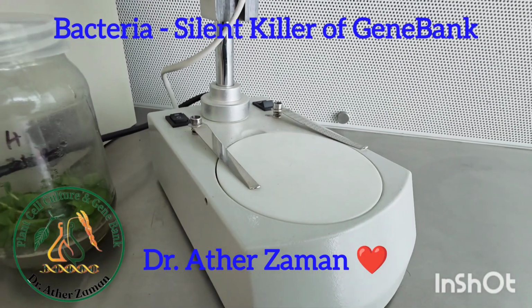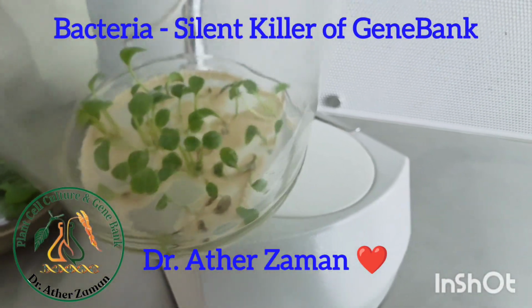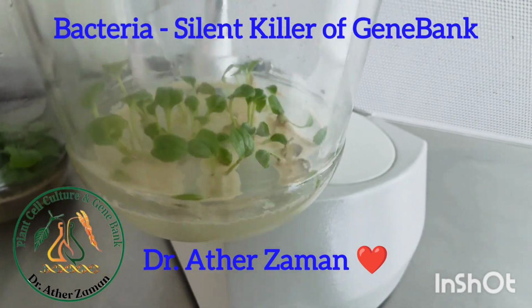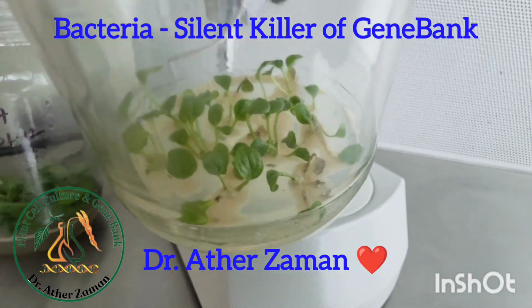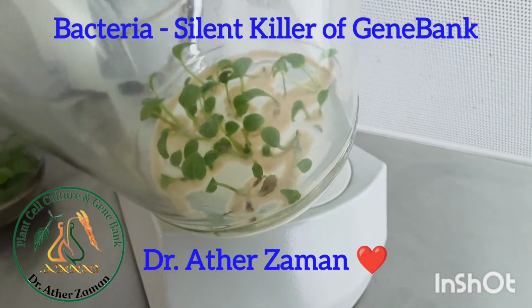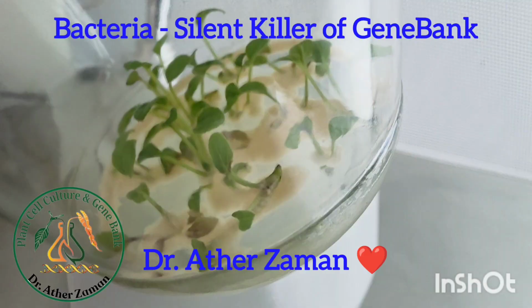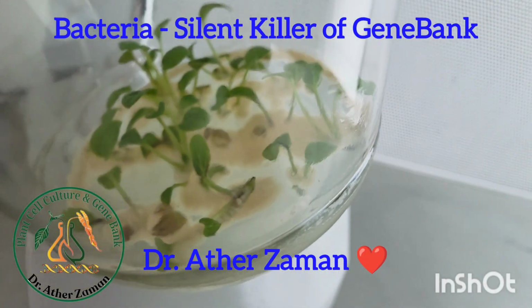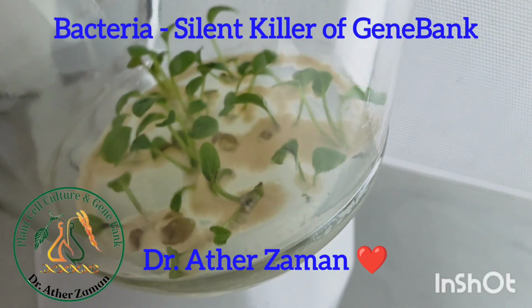Another vessel, you can see this one, is full of bacterial contamination everywhere, but the culture is still good. You see the leaves are still green, but nothing can be done with this culture. We will make a trial to see if we can clean the explant and re-subculture, but I am in doubt whether we will be able to get rid of the contamination here.